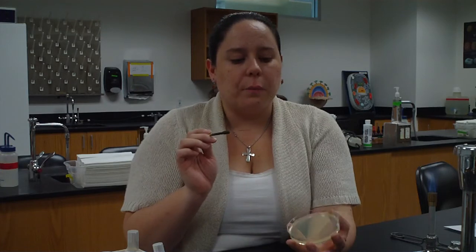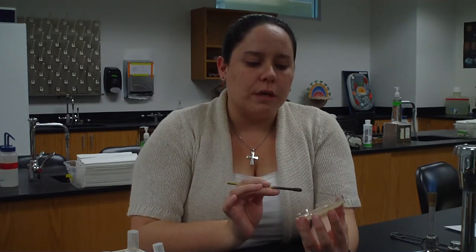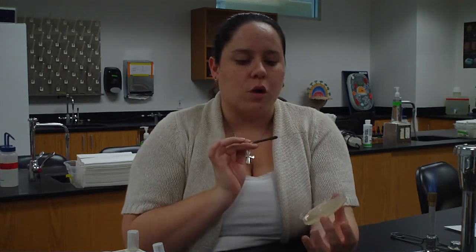Okay, let it cool. Maybe say hi to your neighbor, see how they're doing. Let it cool. Then I open up my plate towards me, look to see where I put quadrant 1, and I'm just going to take a little bit from quadrant 1 and I'm going to turn it 1, 2, 3, 4, 5 into quadrant 2. Close it up, sterilize, let it cool off again. It takes a little while, but if you do it well, you'll get some nice results at the end.